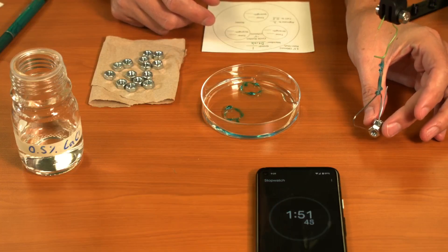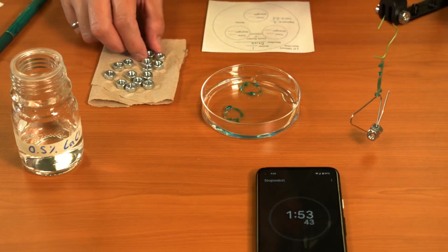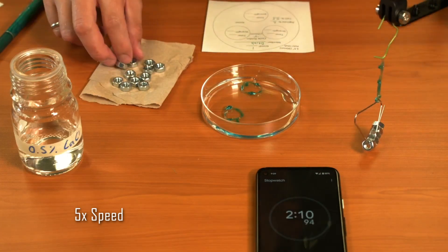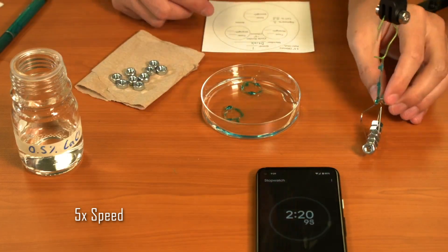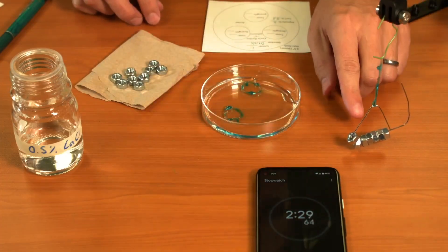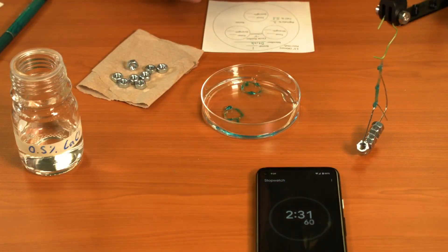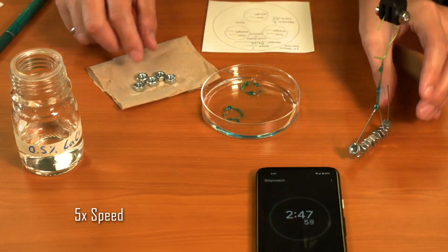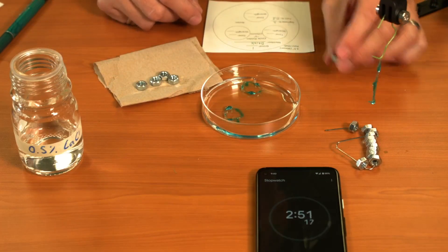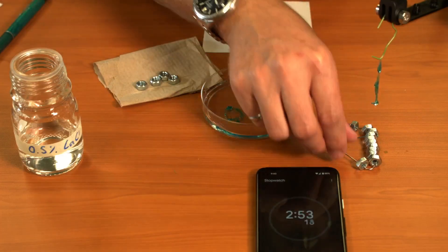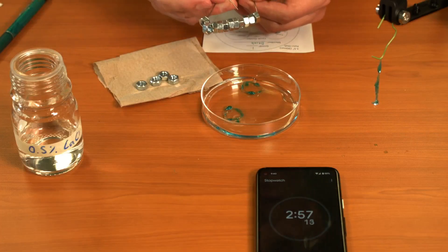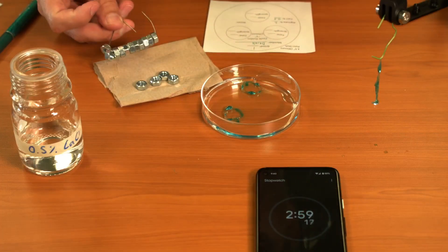Try and be careful not to disturb it too much as you place it. So that was eleven weights on that first trial.